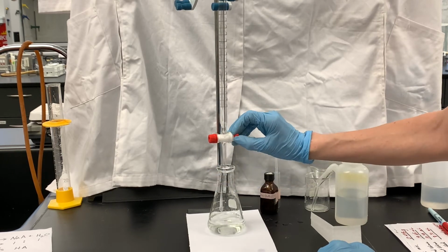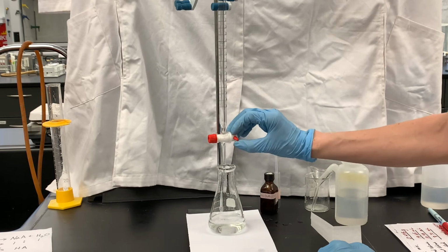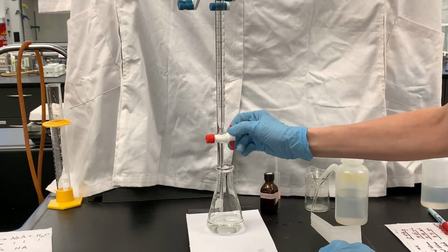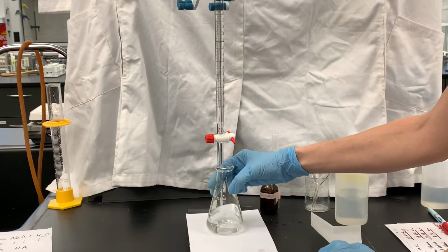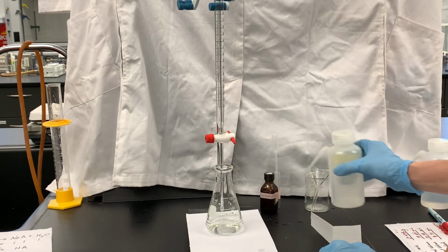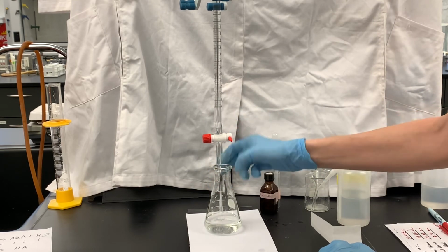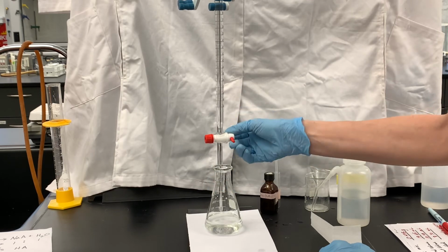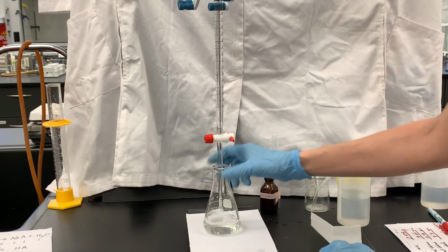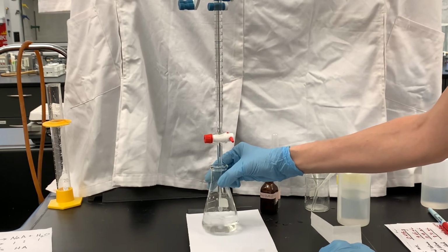Remember that the phenolphthalein actually reacts with base to form that pink color. So what's happening right now is that as the sodium hydroxide is being added into the flask, it's reacting with the phenolphthalein before it has a chance to react with carboxylic acid. So it turns pink, but then the base reacts with carboxylic acid and the pink goes away. What this means, when we see the pink coming and going like this, is that we're getting to a point where there is less carboxylic acid in the flask. We're getting closer and closer to the end point of the titration.